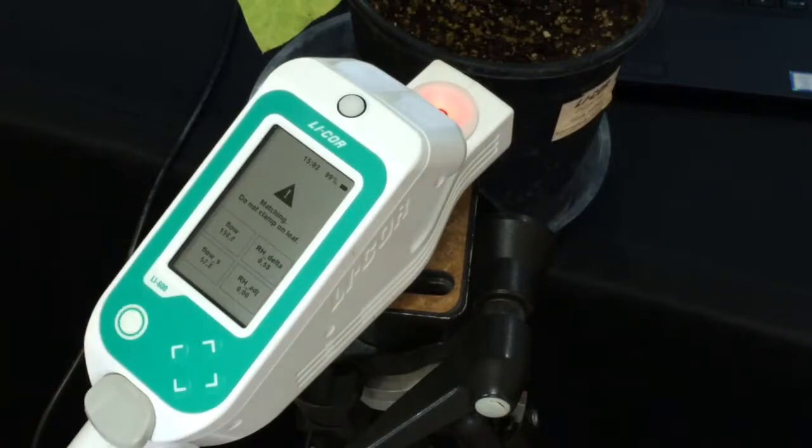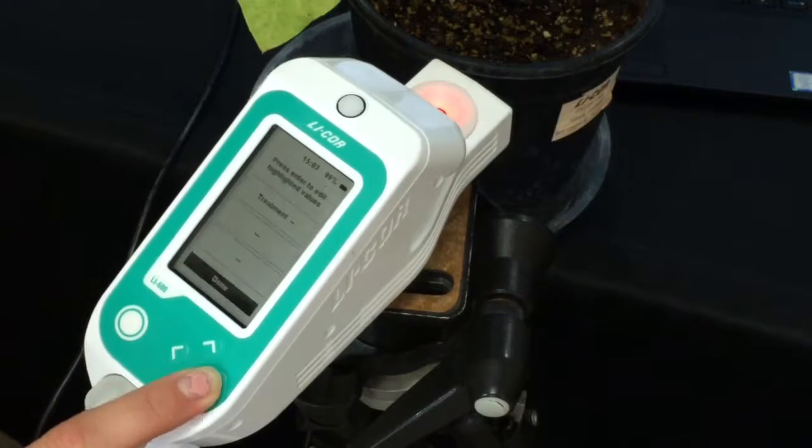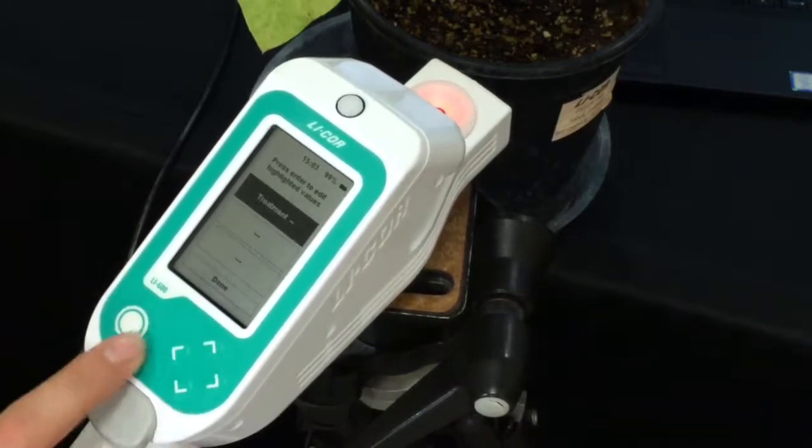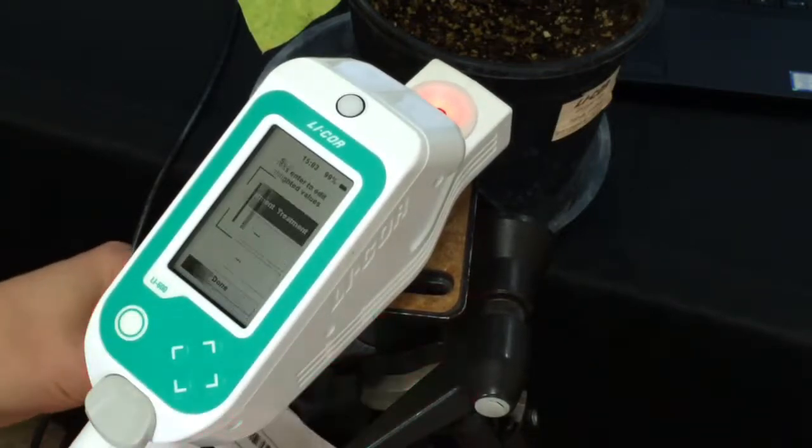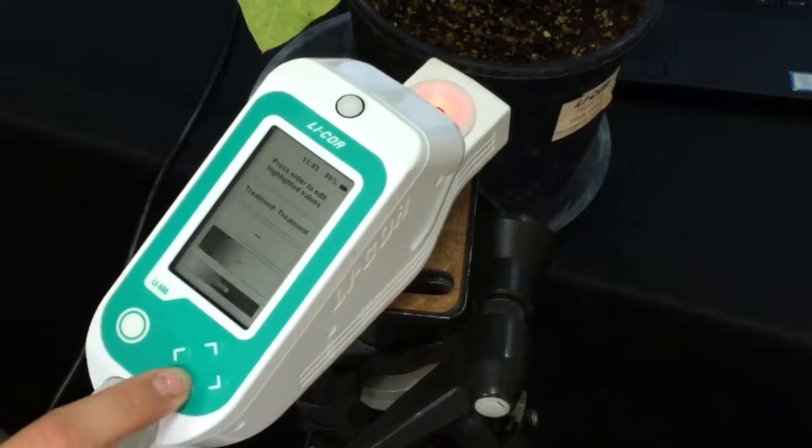And it's going to match. So once it's done matching, I'm moving on to my first leaf. And I want to use the barcode scanner that I just set up. So we'll go here to treatment, we'll scan our barcode, done.